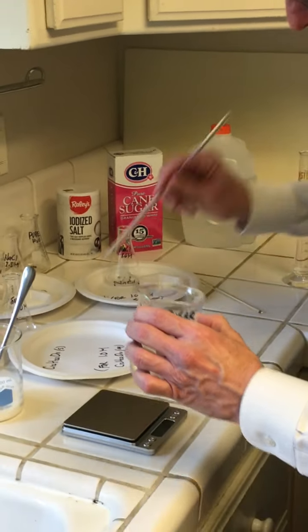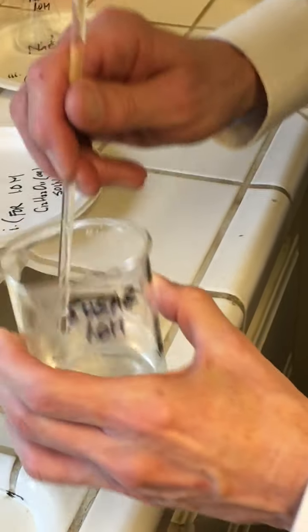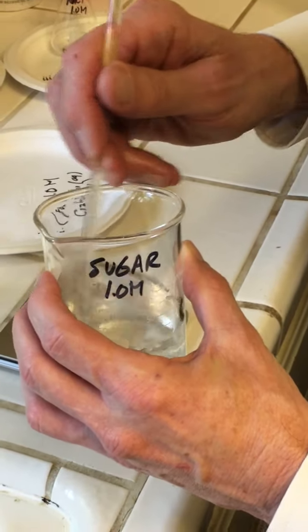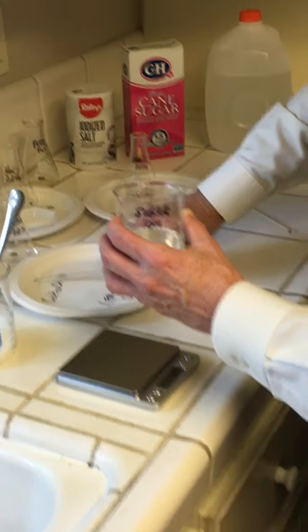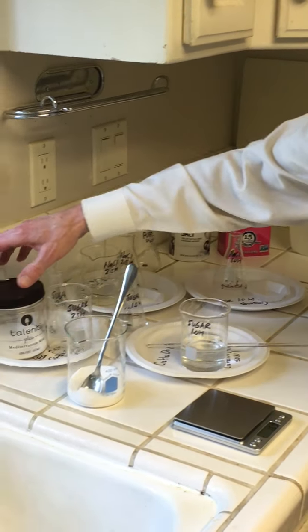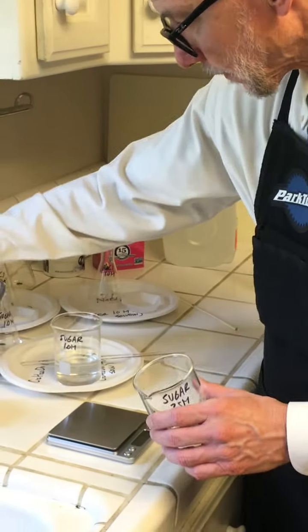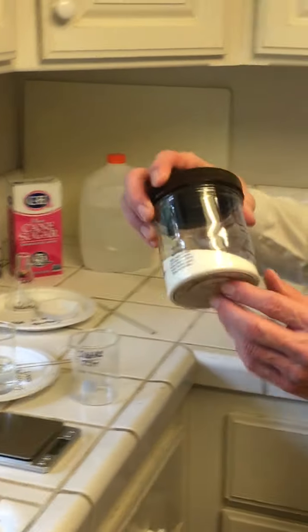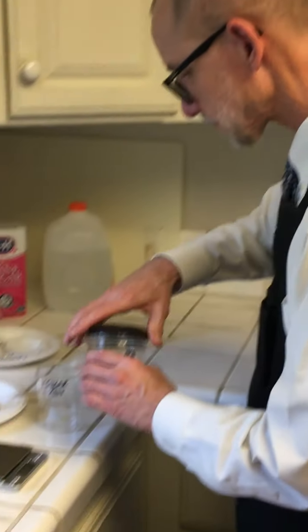Okay, well, I'll let that stir a little more. It's pretty good by the time we get ready to do the boiling point. So there's my 1 molar sugar. Now, I didn't want to weigh out the sugar for the second solution, the 2.5 molarity solution on the film there, so I just weighed it out. Now you can see there's a lot of sugar there.